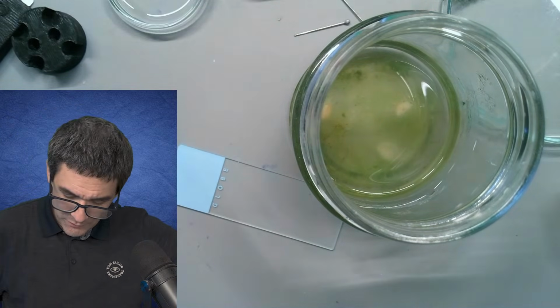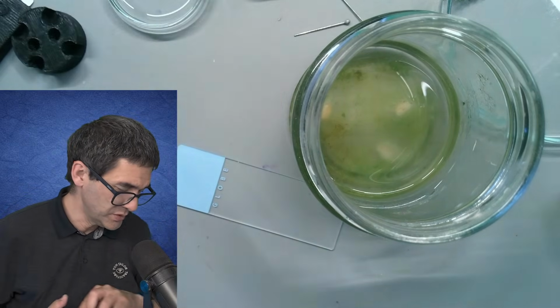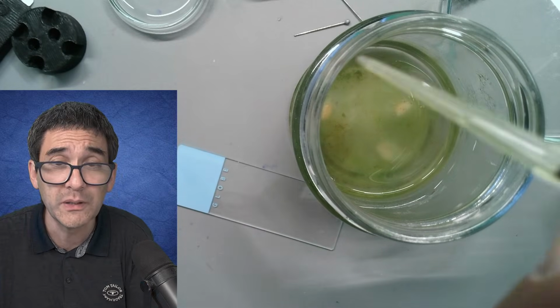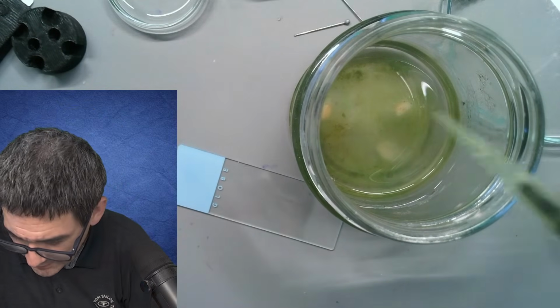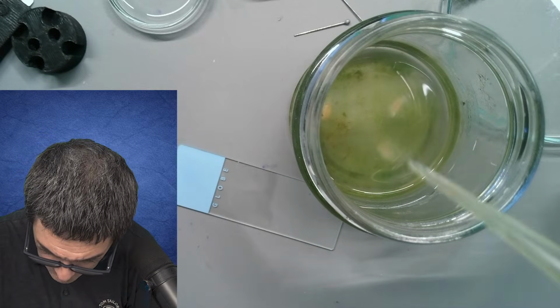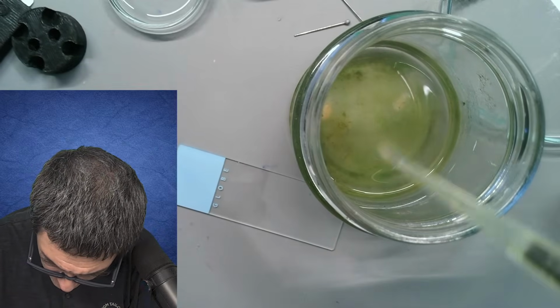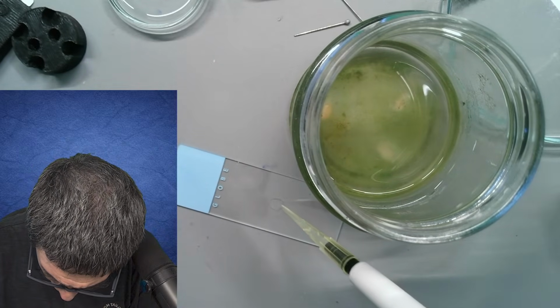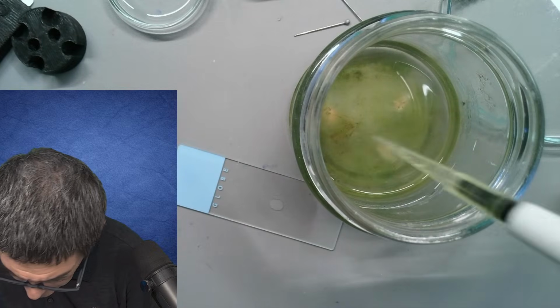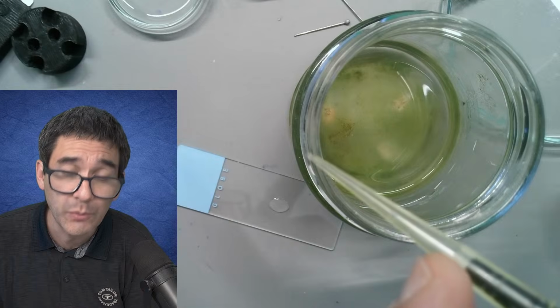So what I'm going to do now, because for somewhat a little bit deeper down, actually I can try to use this here as well. And of course I want to be a little bit careful because there are bacteria and all this stuff on the tip. I'm going to go directly into here. I didn't catch anything. I don't know if I actually caught a lot. No. I think the problem is that the tip is a little bit too small in diameter.